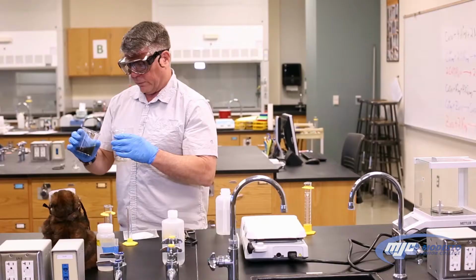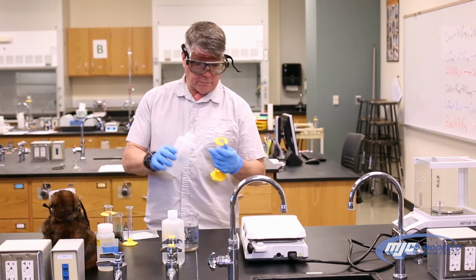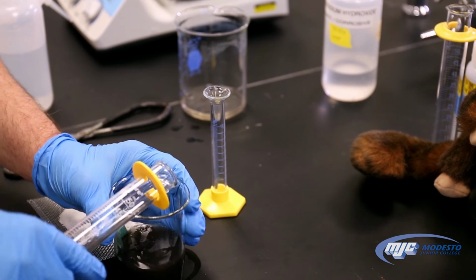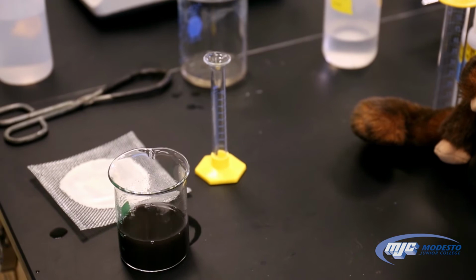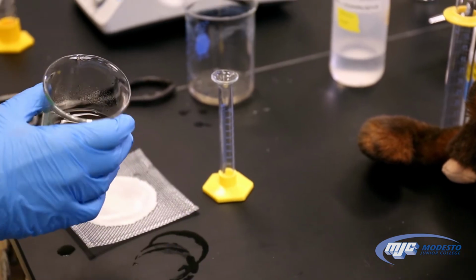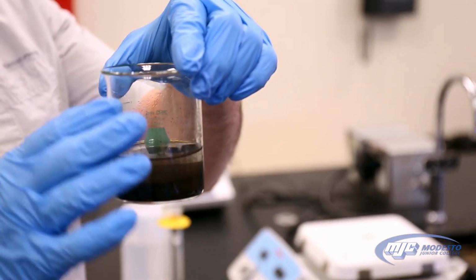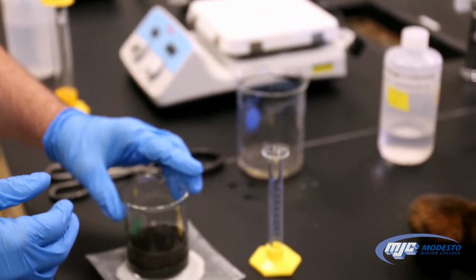I'm going to stop there because I saw some copper(II) oxide starting to get transferred over. I'm going to do that one more time. Add about 25 more mL of DI water. Good enough. Yeah, give it a little swirl. Let it settle down. So if you can see that there's still some cloudiness up here, I want to wait until it settles down a little bit and is more clear. So we're going to set this down and we're going to wait for a few minutes.